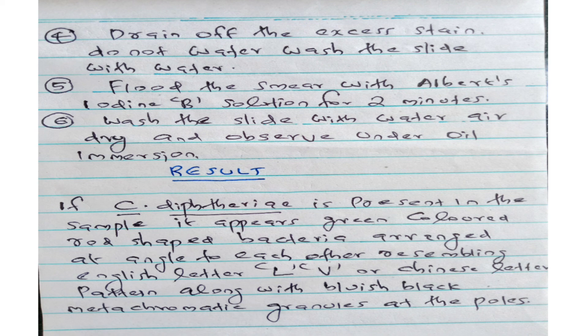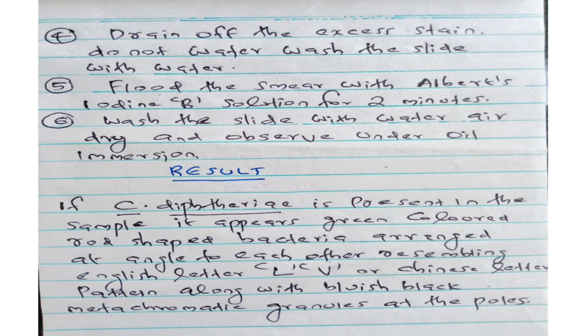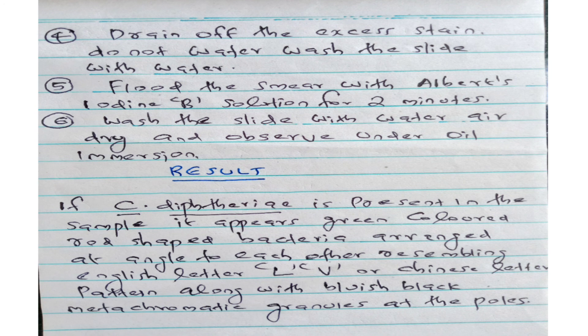What is the result of Albert's staining? If Corynebacterium diphtheriae is present in the sample, it appears as green-colored rod-shaped bacteria arranged at an angle to each other, resembling the English letters L or V, or a Chinese letter pattern, along with bluish-black metachromatic granules at the poles.